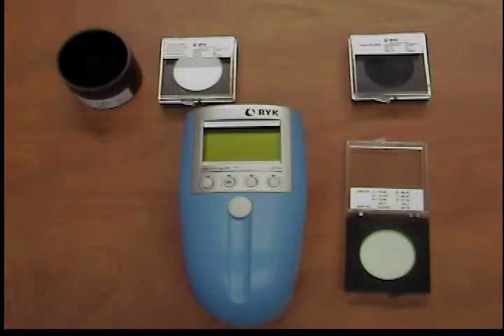Clean standards with a moist cloth. Never use window cleaner or any abrasive cleaning agents. For stubborn stains, saturate the cloth with ethanol.